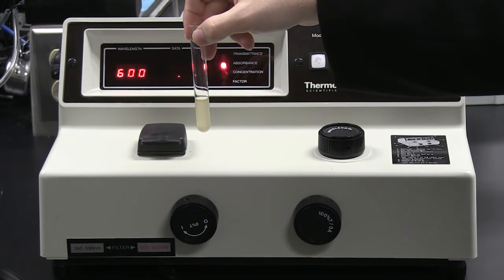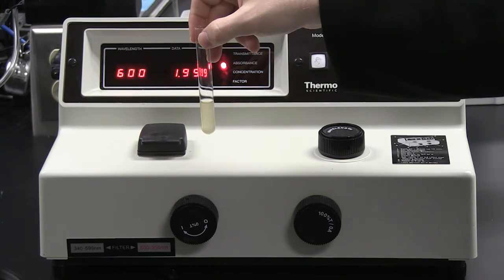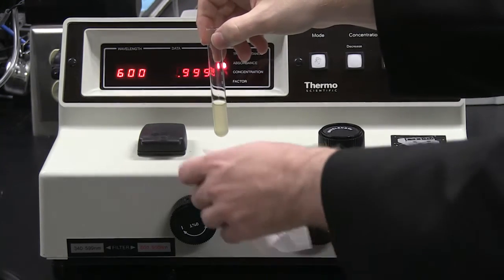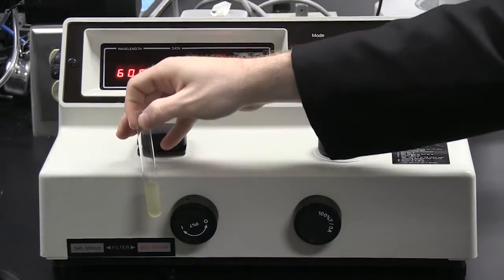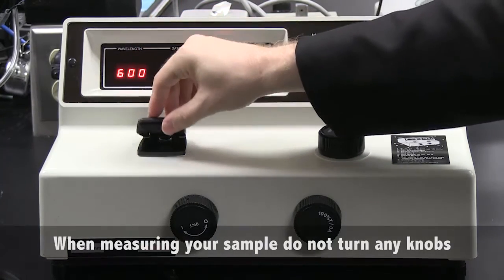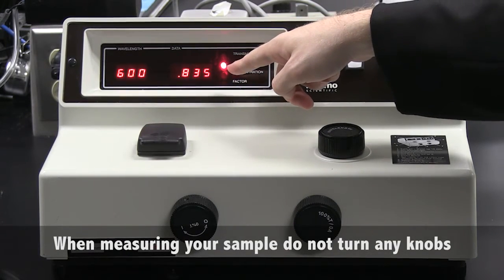I now want to measure the absorbance of this sample. If you look, you can see that unlike the previous sample, which served as our blank and was clear, this sample is turbid. To measure the absorbance of this sample, I will open up the sample compartment. I will wipe down the test tube with my Kim wipe tissue. I will open up the sample compartment door, put in my sample, close the door, and read the number that appears.